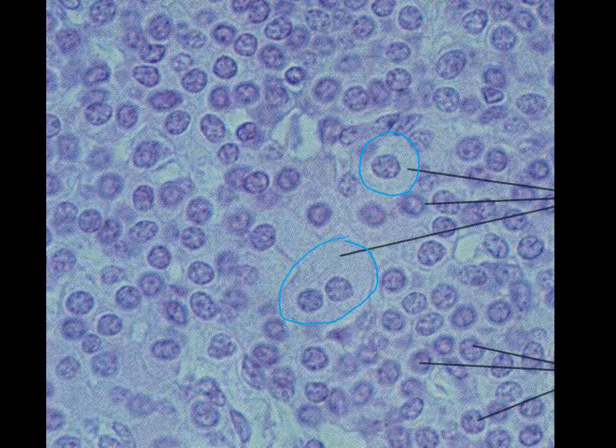And so those cells are essentially almost like a chromophobe as far as the cell goes. So they don't really have very much as far as the stain in the cytoplasm that is there. So we don't see that all that much. And then the other cells that we have there are the chief cells. And so the chief cells are the smaller looking cells, and they're also the more abundant cells that are there. And so two different kinds of cells within the tissue itself.